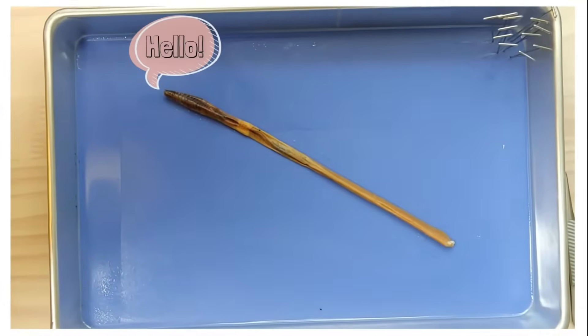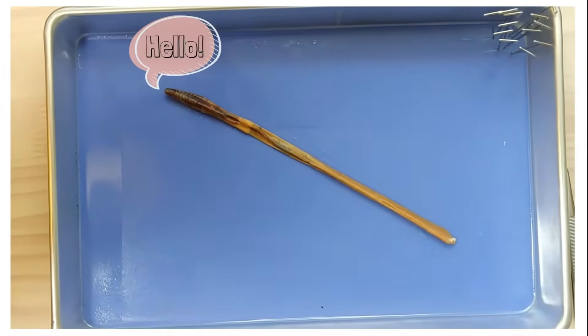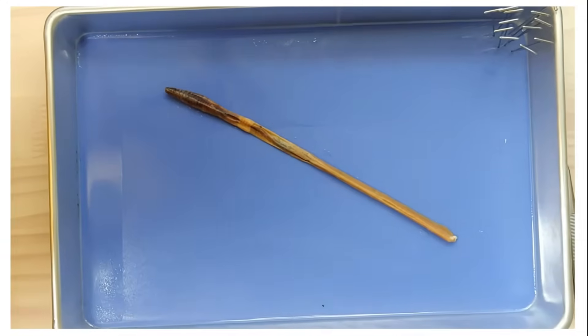Hello and welcome to a worm. Today we'll be looking at the anatomy of a worm.